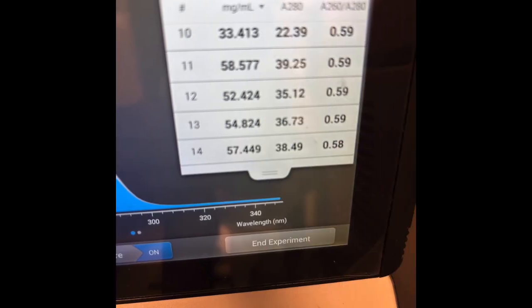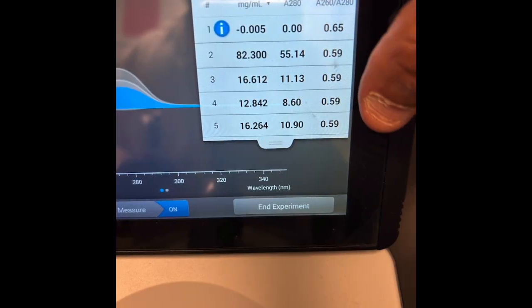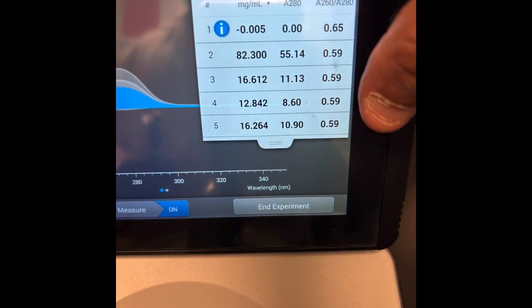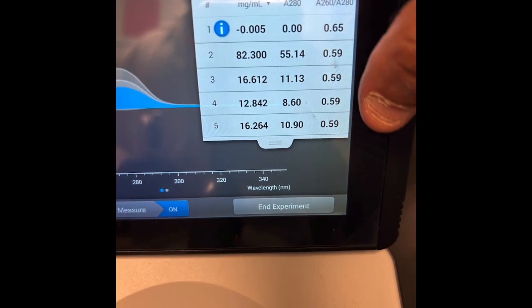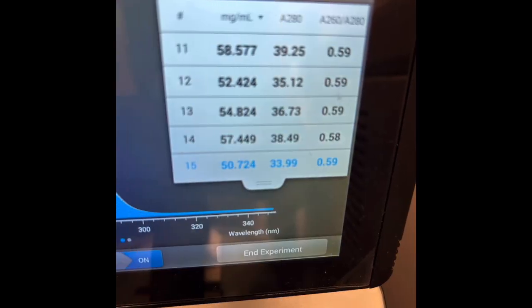This shows that the Opentrons at higher volumes is definitely much more precise. At 5 microliters, it was pipetting less than 1 to 2. It was like maybe 3 to 4 almost. Maybe 6 to 10 instead of 5 to 10 or 1 to 2. But it was still much more precise than the almost double the volume that it was pipetting when it was 1 microliter. And even me as a human messed up, since as you can see, the milligrams per milliliter is 50.7 to 82, when it should be about 41. So the Opentrons is not that much worse than a human, or me as a human.